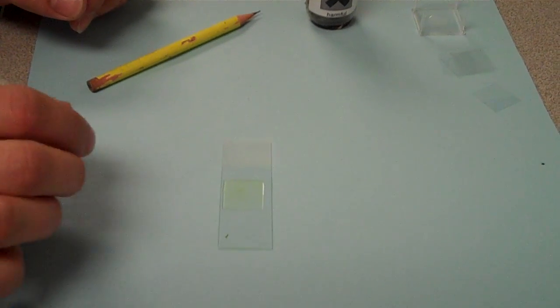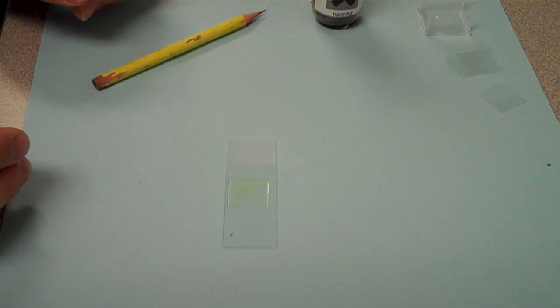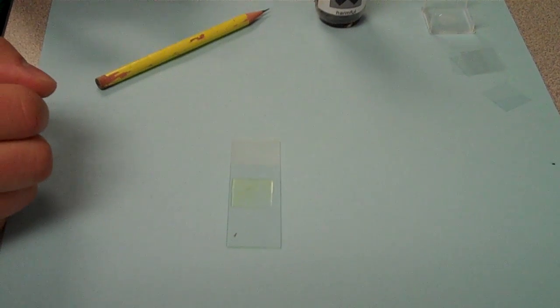Try not to touch the edge of the cover slip, or you could suck out all the liquid. That's basically it. Then you tuck it on your microscope, and have a look.